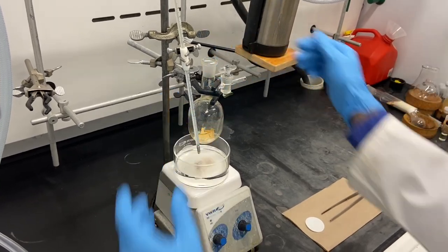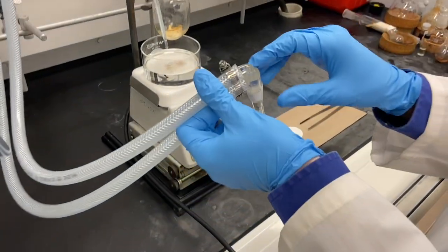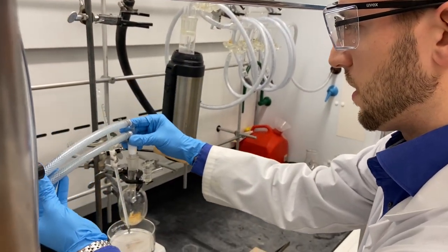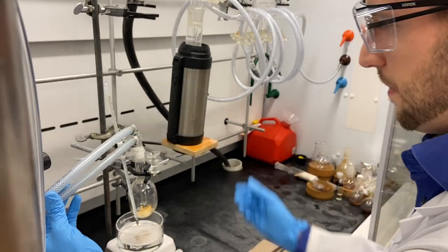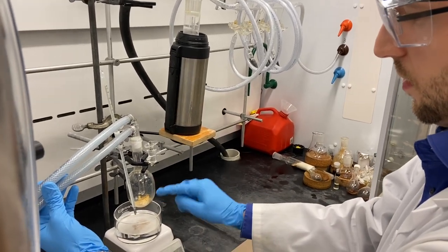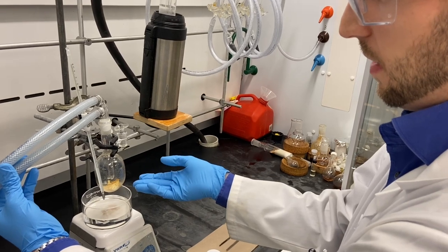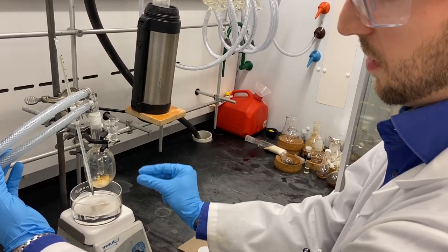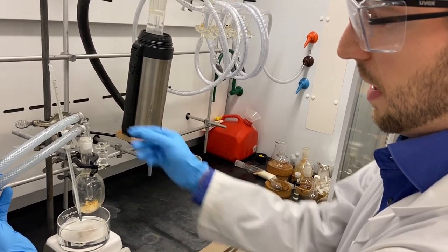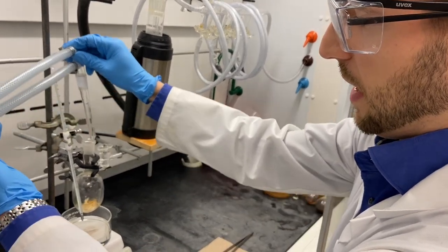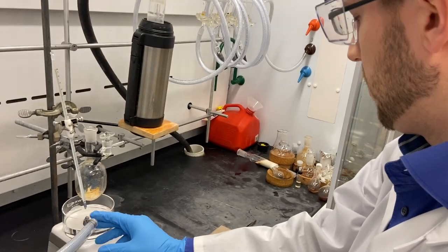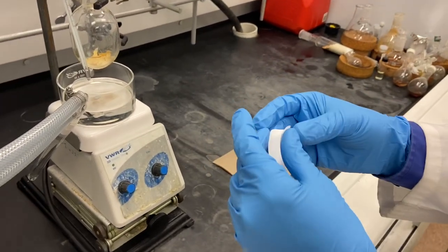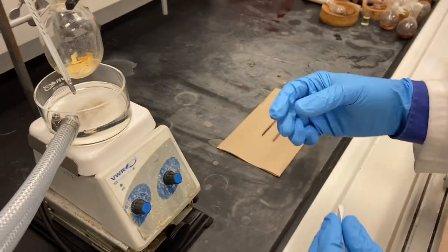We did a column chromatography of this compound earlier but didn't clean it perfectly. That's why we are choosing the sublimation. What we like to do instead of having a setup where eventually the particles down there get so small that the vapor pressure of the compound will lift them up, we like to put in a piece of filter paper. This will just prevent dirty parts of the material from flying up.